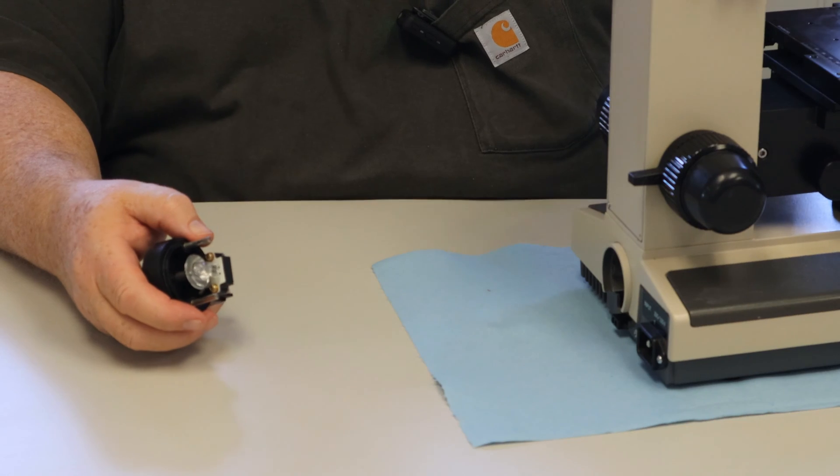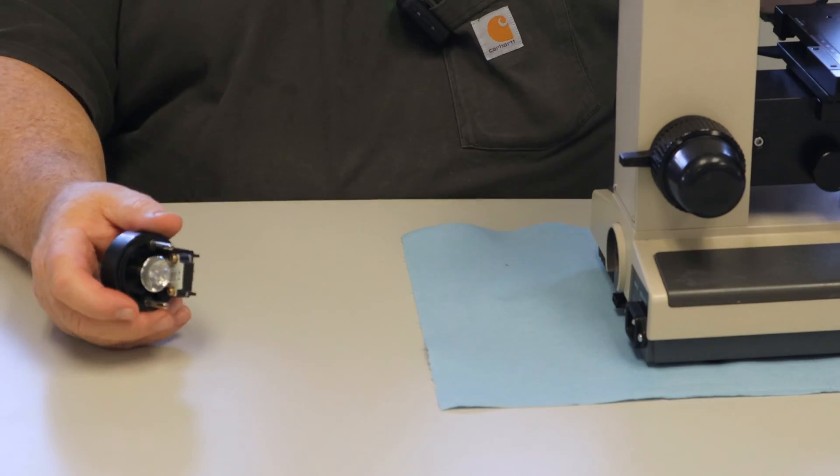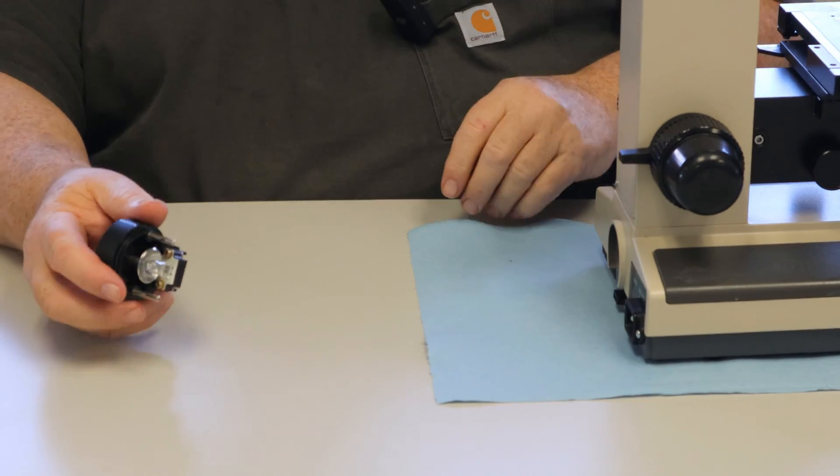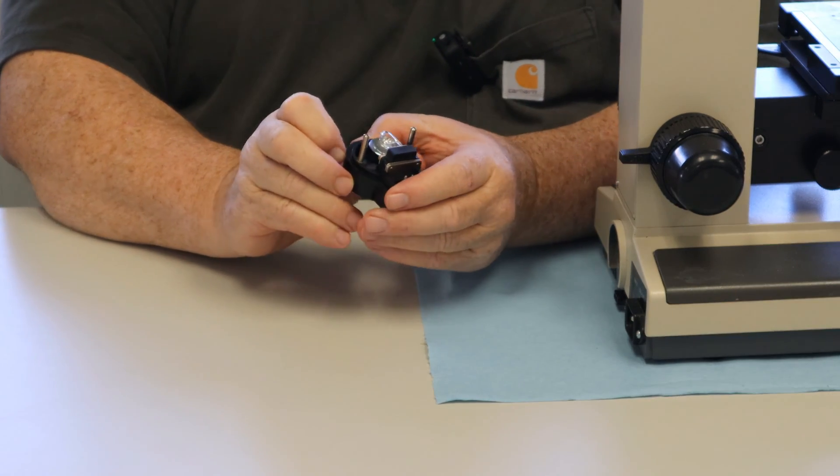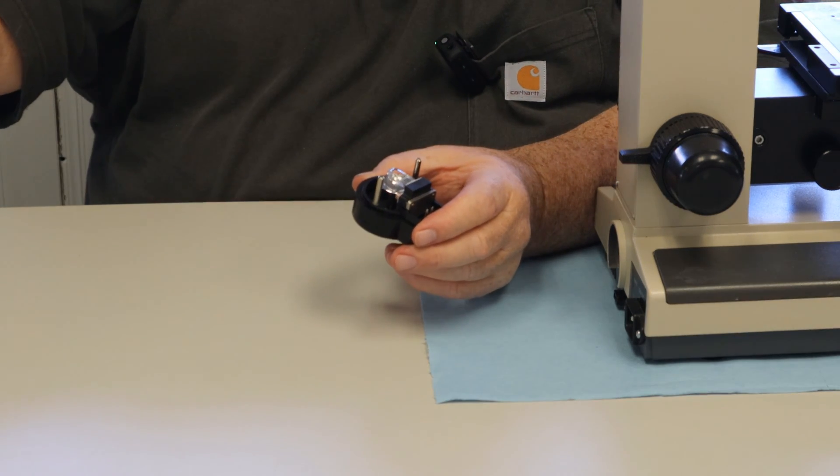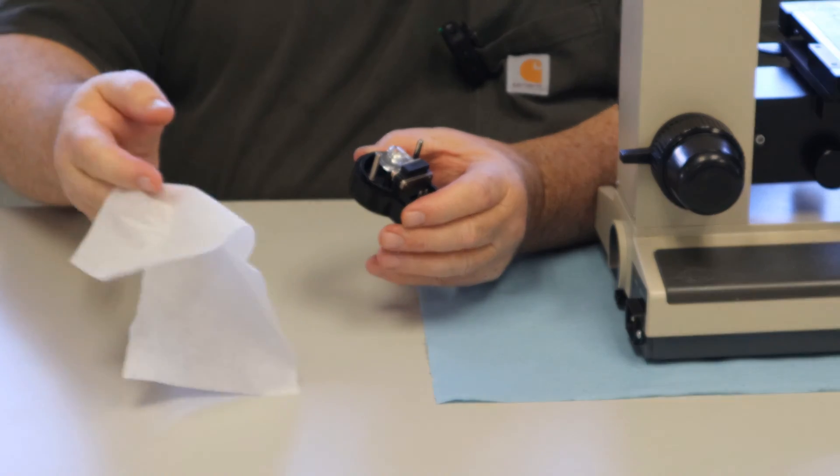If one day you find out your scope will not light up and you do have it plugged in, you might try checking your light bulb first. Today I'm going to show you the very simple method of changing this light bulb.